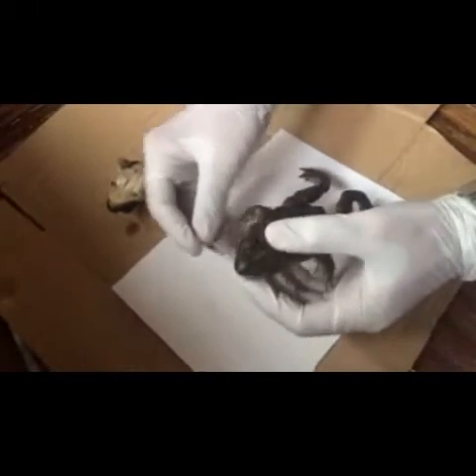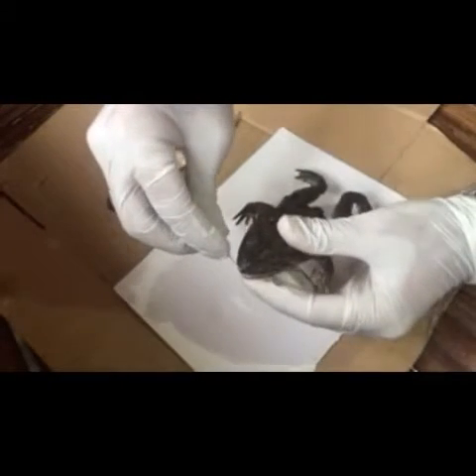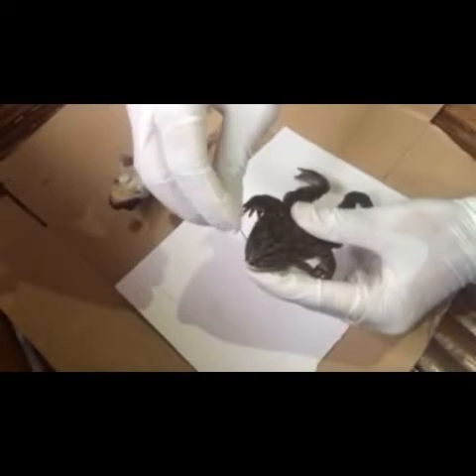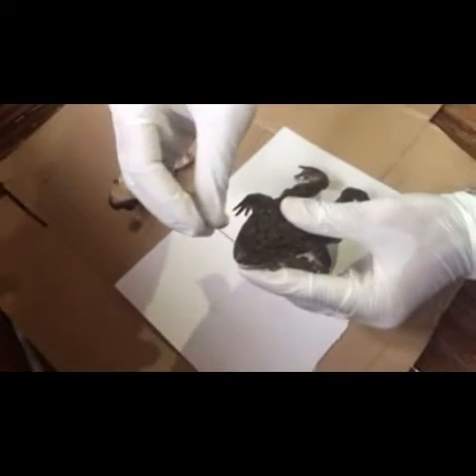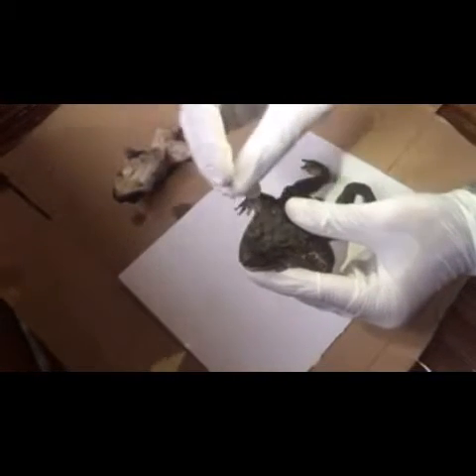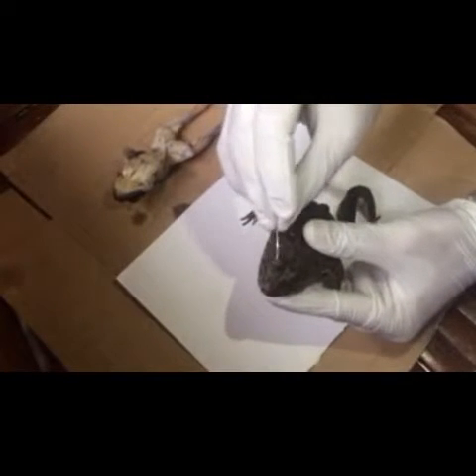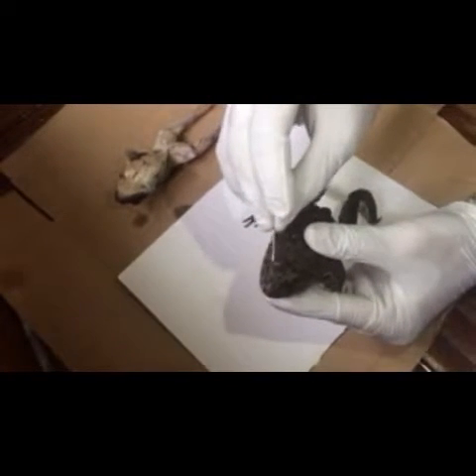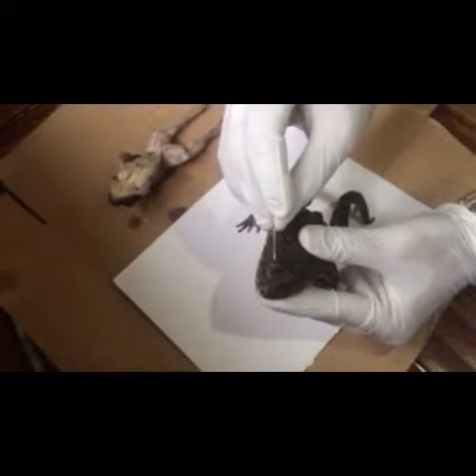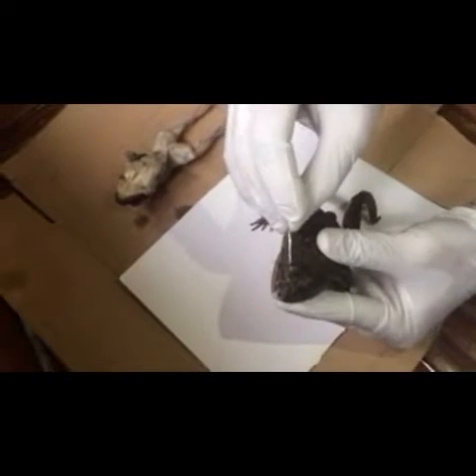First things first, this is the snout. And then the external naris, the brow spot, and then the upper eyelid. Then in the center, the nictitating membrane, and lower eyelid.